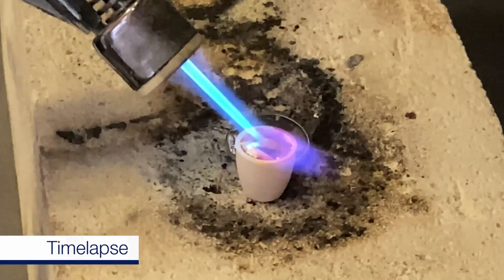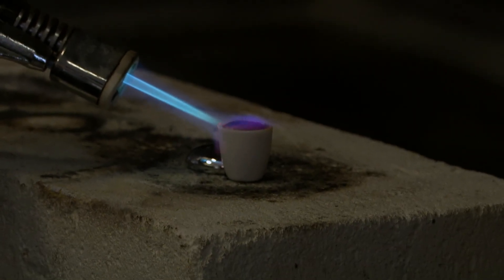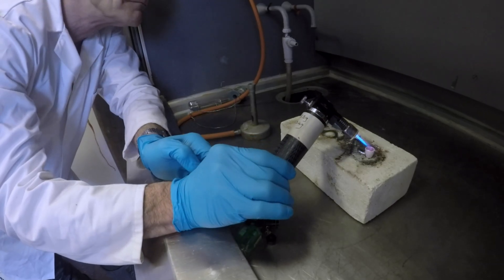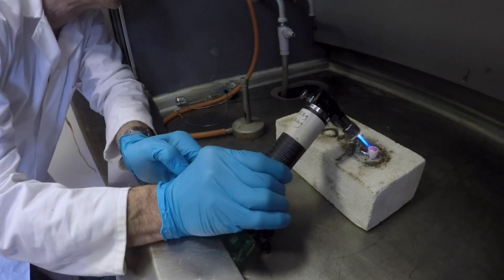The first one was just to take a crucible with indium in it to heat the indium up until it melted and then put a blow torch on it. That is a high temperature gas flame and see what we could see. And there was a really nice indigo color. Brady was really excited. Unfortunately, that was just the time I chose to go out of the room to a meeting. So I missed it. Actually, they didn't see the color straight away but they had to heat the indium pretty hard and then the color appeared.